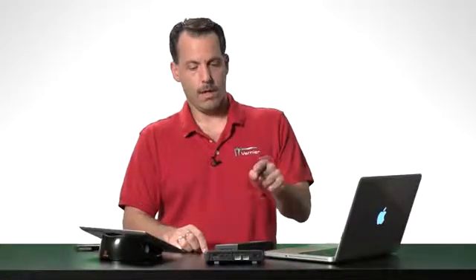Hi there. I'm going to show you how to connect a LabQuest2 to a wireless network so that you can use LabQuest Viewer, data share, or graphical analysis for iPad in your classroom or wherever you are. The most important thing that you need to know is that all of the devices that you're going to be using, whether it's a computer, a LabQuest2, a tablet like an iPad, or even a phone like this iPhone, they all need to be on the same wireless network.